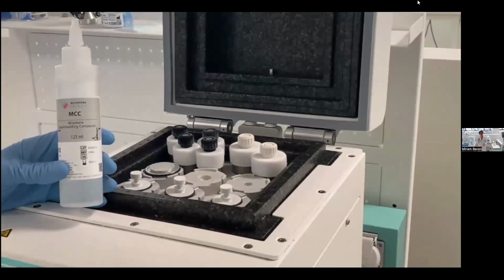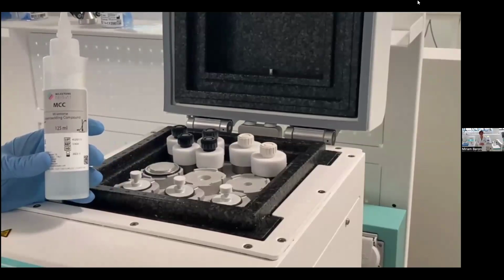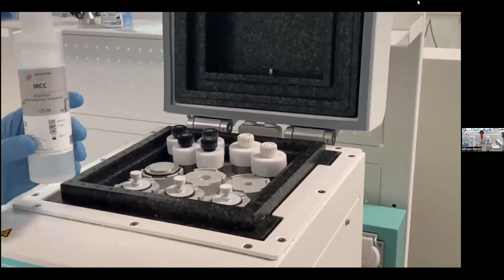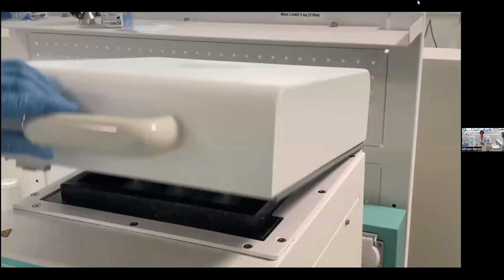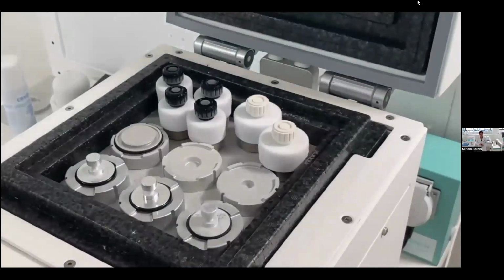This allows me to use a medium that is more liquid than a conventional medium. MCC improves the transfer of the sample into the mold, but also creates the perfect connection between the frozen sample and the surrounding medium, avoiding the curling effect that we'll see later on in the cutting part.